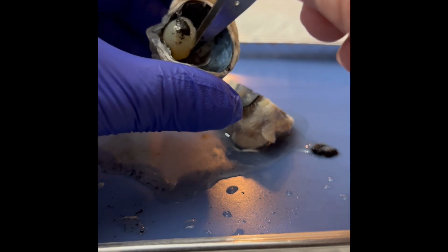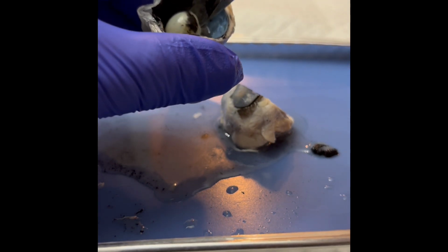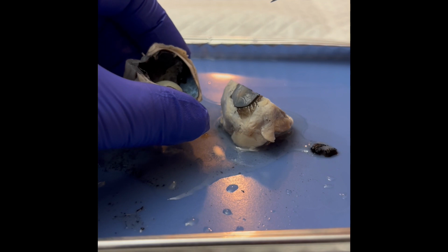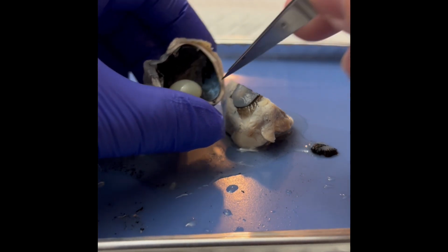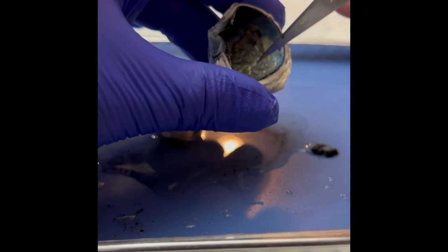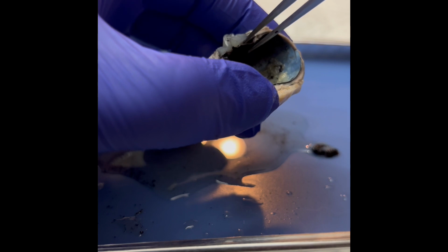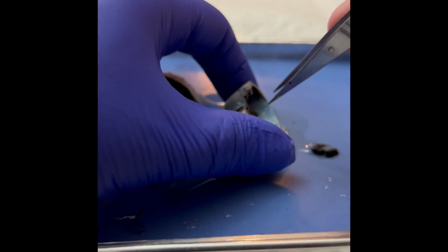through the pupil, the hole in the center, through the lens, where it's focused onto the retina, and then finally through the vitreous chamber, where it's focused onto the retina back here. The structure that serves as the sensor in the pupillary light reflex is going to be the photoreceptors in the retina back here. And then the structure that acts as the effector in the pupillary light reflex is the iris here that's going to constrict or dilate as necessary to let more or less light in.